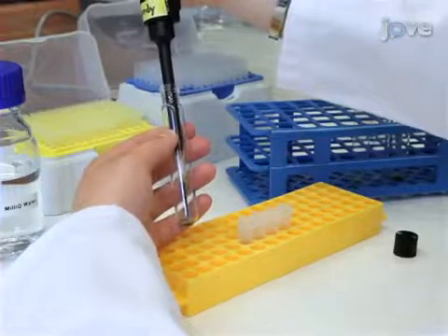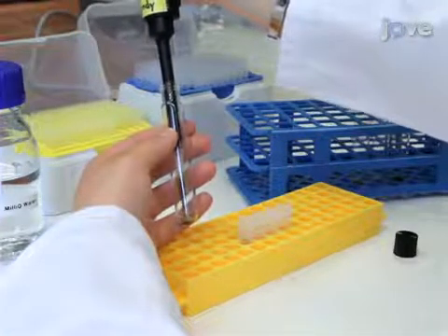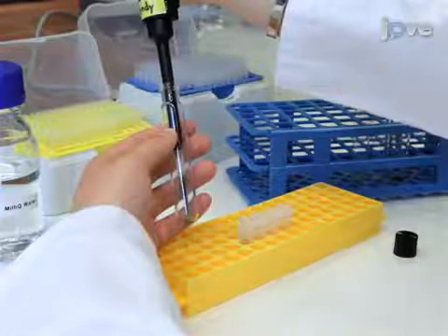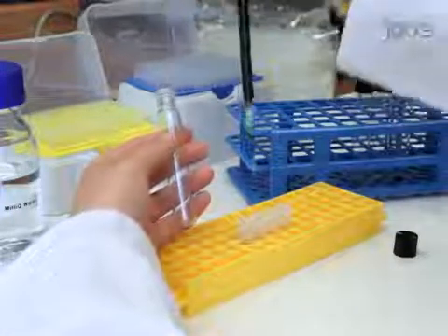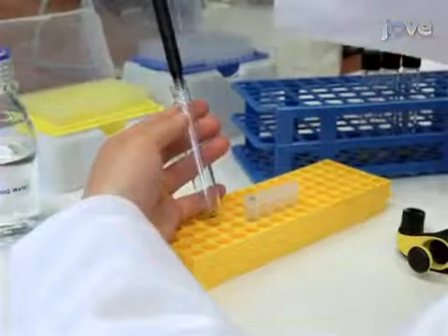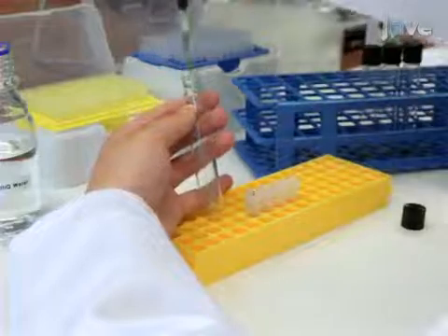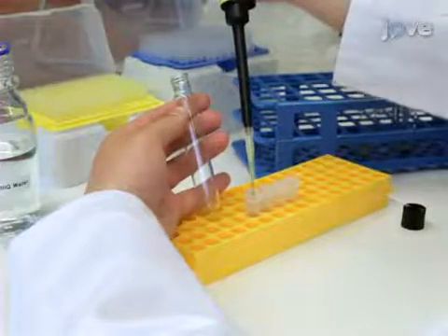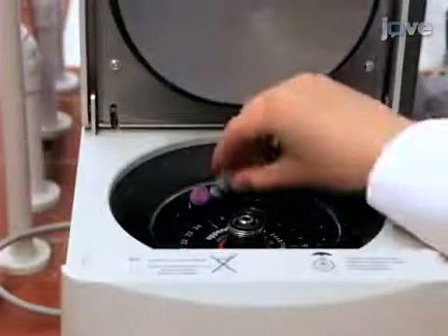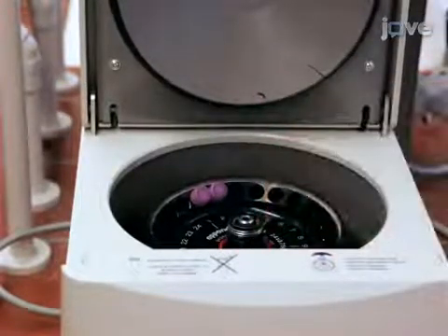Next, resuspend the algae in the remaining supernatant by gently pipetting the pellet up and down, and transfer the cell mixture to a bead beater tube using a 200 microliter pipette. Rinse the centrifuge tube and pipette tip with approximately 0.15 milliliters of MilliQ water and transfer the liquid to the bead beater tube. Centrifuge the bead beater tube for one minute at maximum RPM to make sure no air bubbles remain in the bottom of the tube. When finished, lyophilize the material.